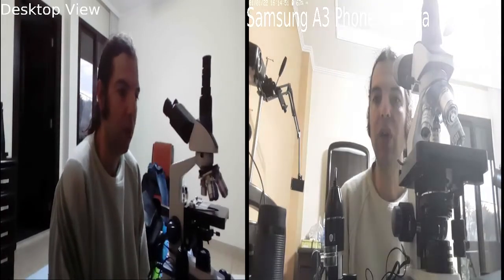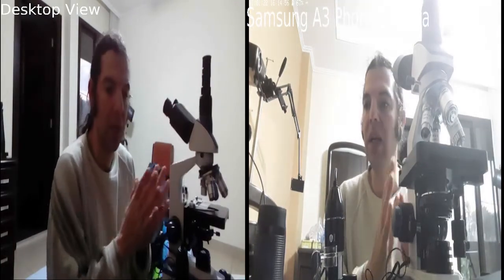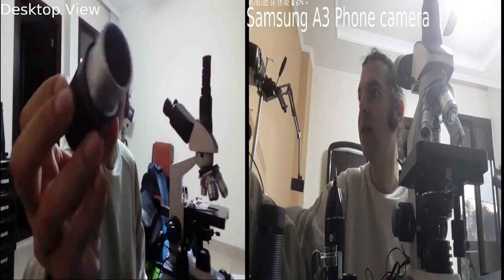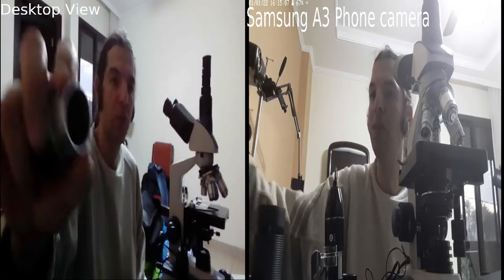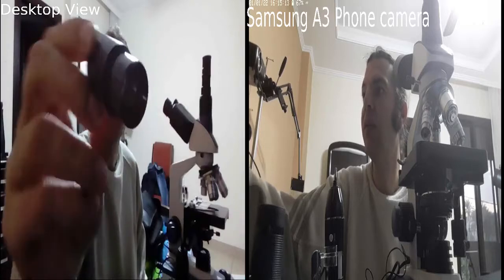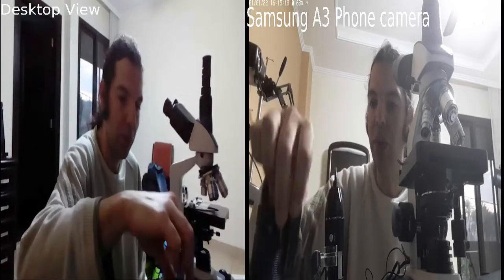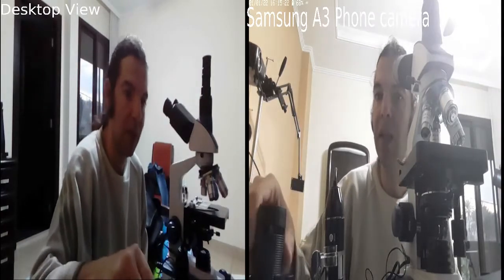So, in this video, I want to answer a question. Here I have a microscope. I have also telescope eyepieces. Those are telescope eyepieces, and they have a diameter of 1.25 inch, or 1 1/4. Those are 23 millimeters, 0.5, something like that, for microscopes. Those are the eyepieces of microscopes. So we're going to see how and whether we can use the telescope eyepieces.